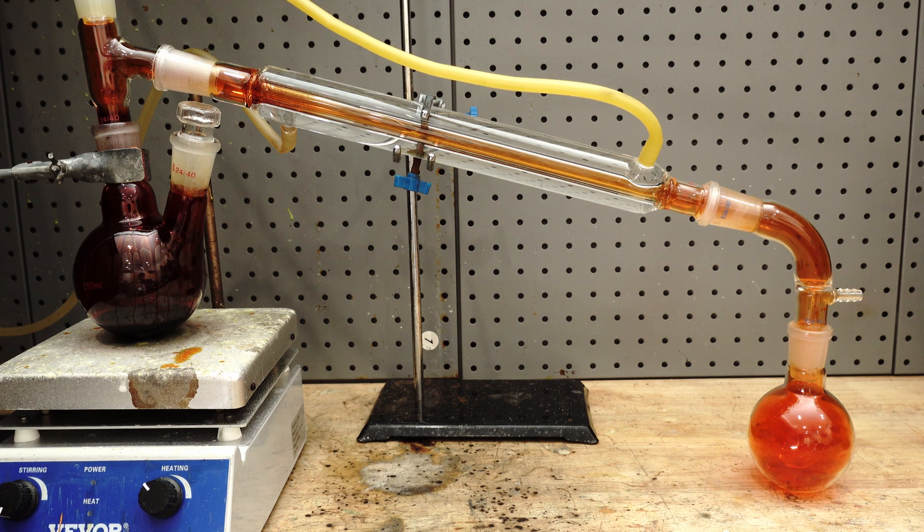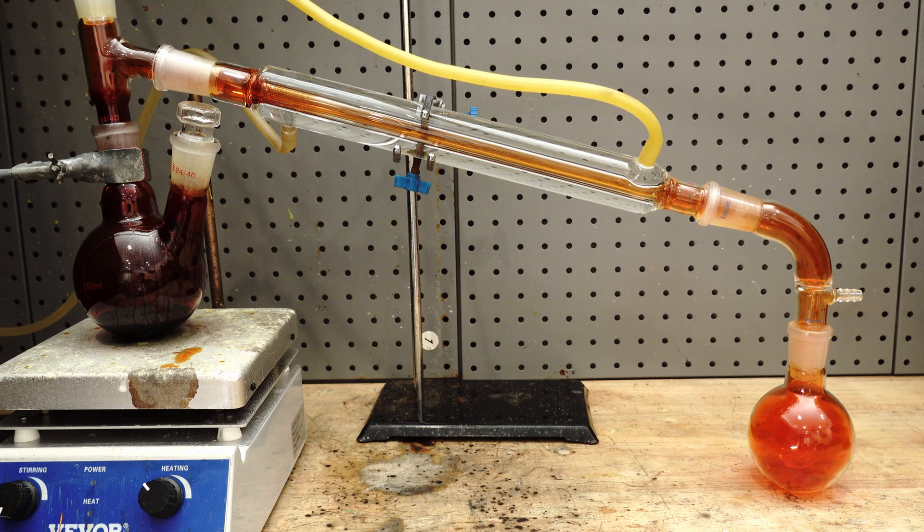The boiling point of sulphuric acid is way higher than that of Bromine. So the Bromine will be pretty much the only thing that distills over.